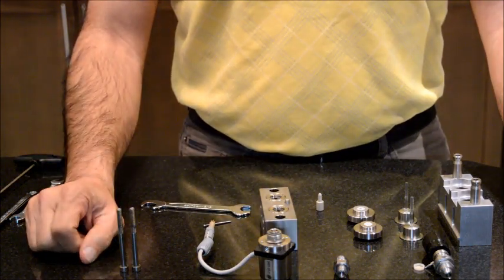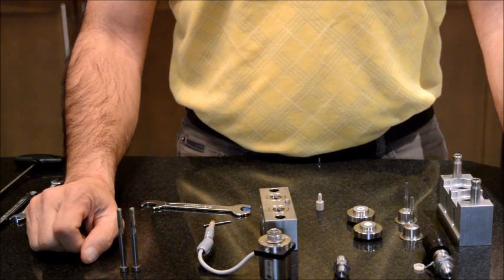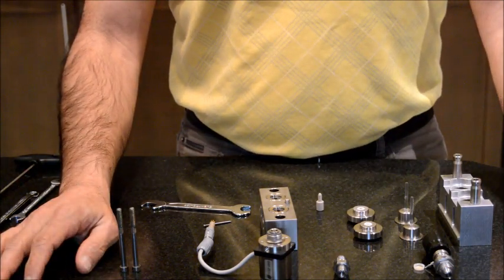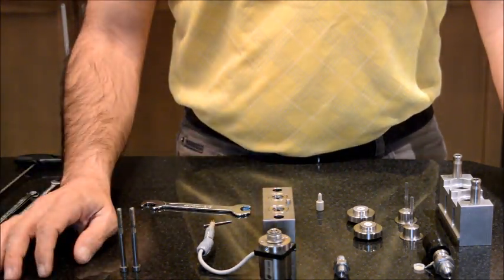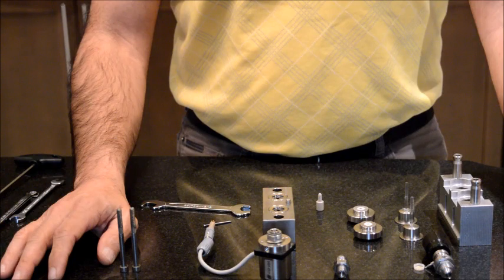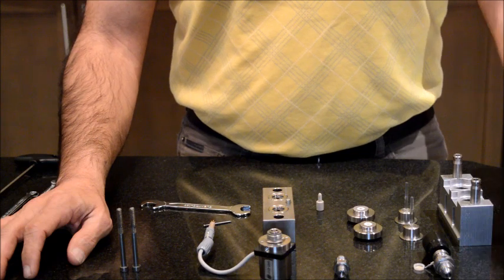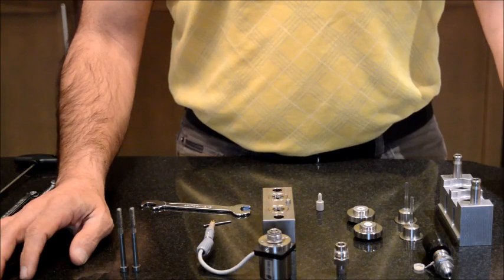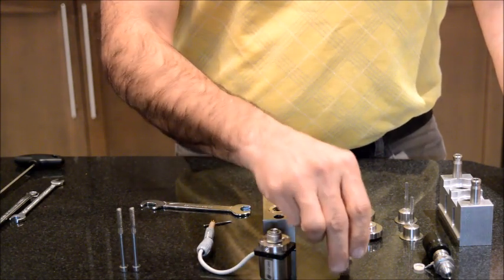Number three that comes to my mind is methods that you run on the HPLC that create a lot of back pressure. In the case of Agilent, I would say something in the range of 300 bar, 350 bar. Although the Agilent will not shut off until it reaches 400 bar, operating the machine at 350 or anything above will put a lot of pressure on these components. The one that breaks down very rapidly is the outlet valve. The outlet valve is going to go bust, and then you realize you're running your method and every 2 or 3 months you have to replace the outlet valve.